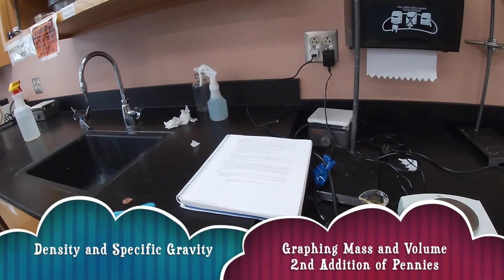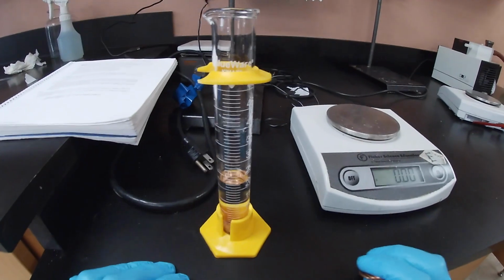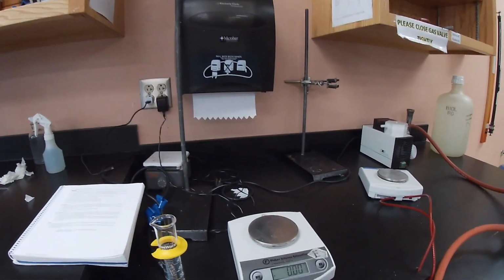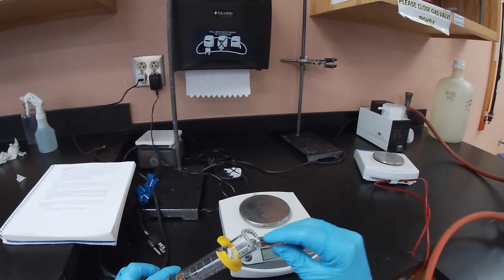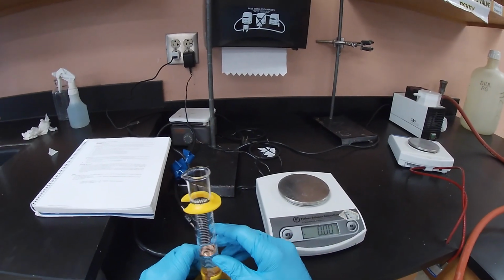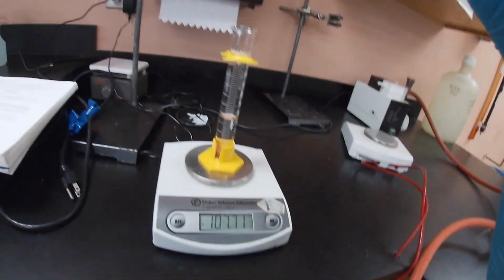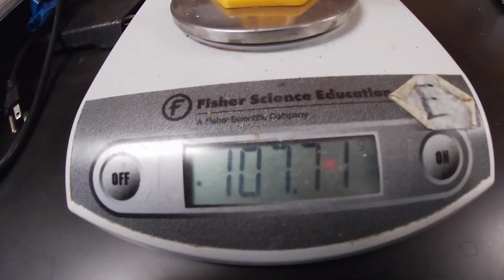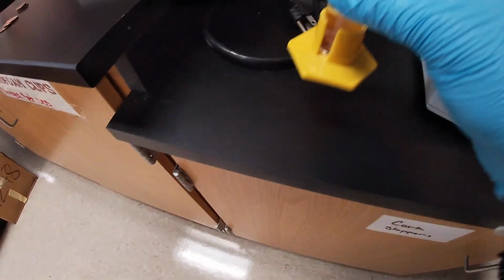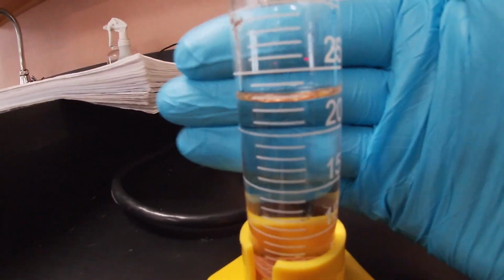Let's do our second addition of the next 3 pennies. We already have 3 pennies in there at a volume of about 21 milliliters, and a mass of approximately 100.31. We add our next set of pennies and put it on our scale, and our scale reads 107.71. We take out our graduated cylinder so that we can record the volume, and it went up to about 22 milliliters.